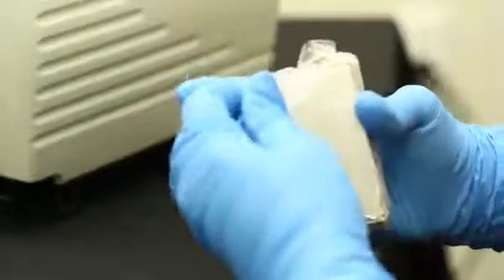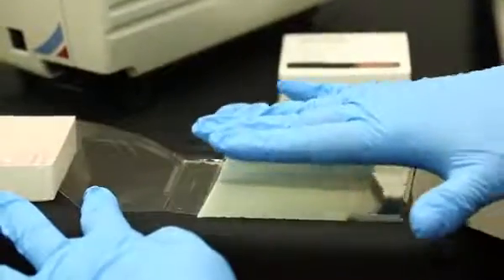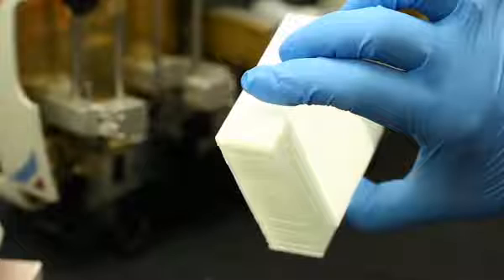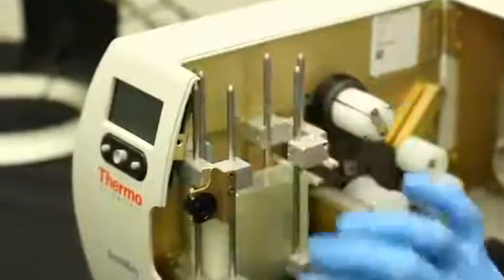How to load slides. Always use approved slides to ensure proper operation of the SlideMate. Wear gloves when touching slides. Fan slides out to make sure the slides are not stuck together. Stack slides painted surface up and painted end closest to the front of the SlideMate. Lower slides into the input stack.